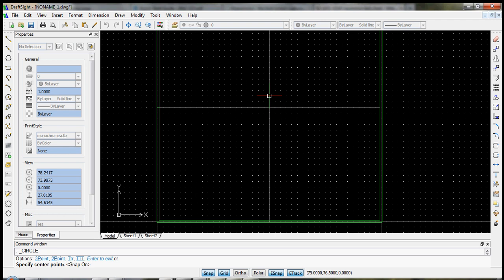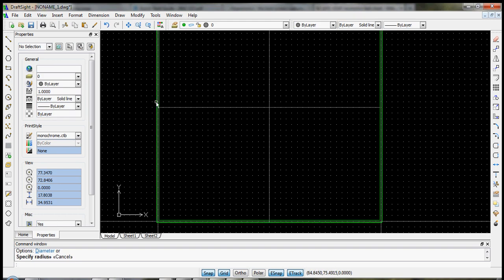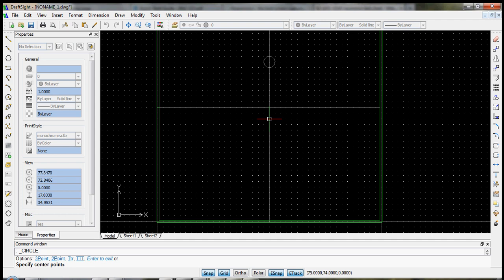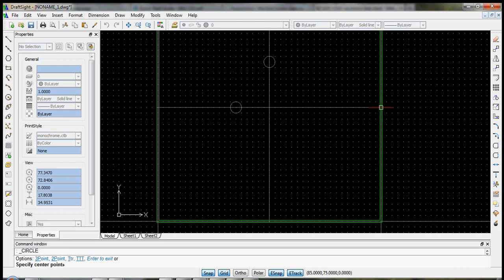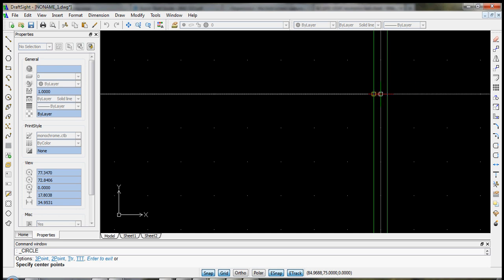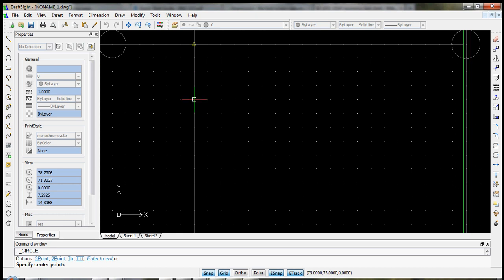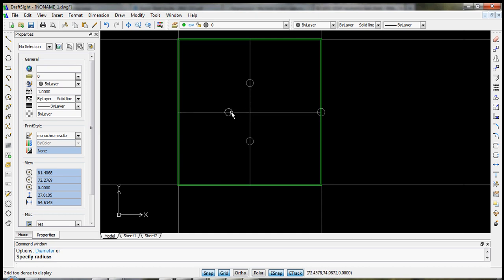Our goal is to move now 1, 2, 3, 4 millimeters up. 1, 2, 3, 4, and horizontally we'll go 1, 2, 3. And we'll go 10 millimeters to this side, which I know is going to be this point. Right here. And one last circle. 1, 2, 3, 4. Okay, so now I have 4 millimeters vertically, 3 to the left, 10 to the right.